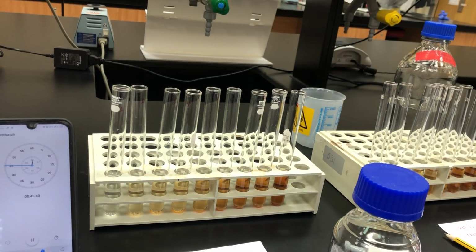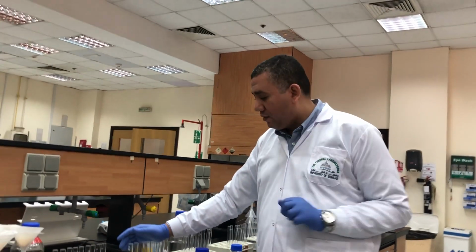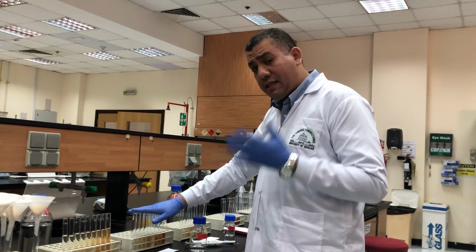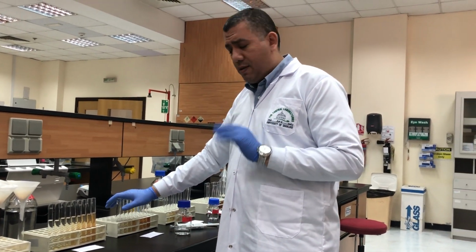What will happen during the 10-minute incubation? Digestion happens by the pepsin. Pepsin will digest the protein in the acidic media. As we understand, pepsin is a protein that works at pH 2, as you understand all of this information. I explained this in the theory part. Here now, I was waiting for 10 minutes.